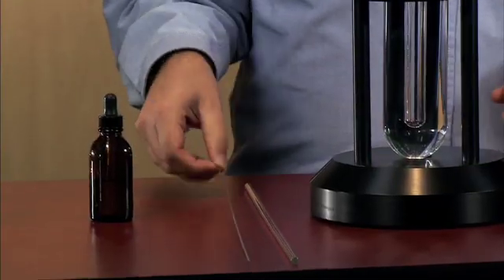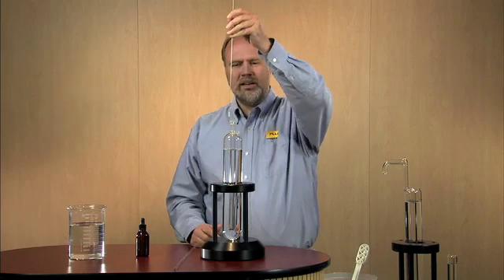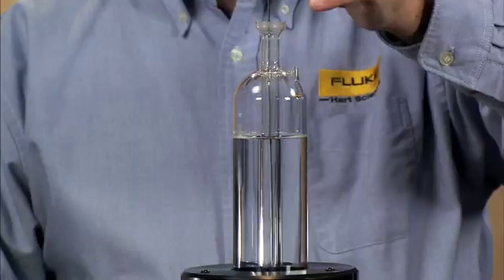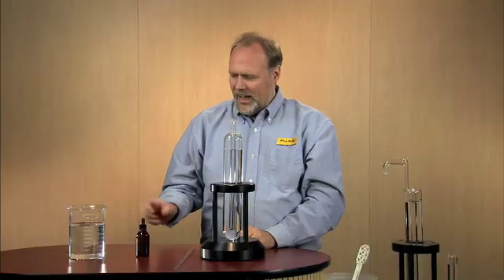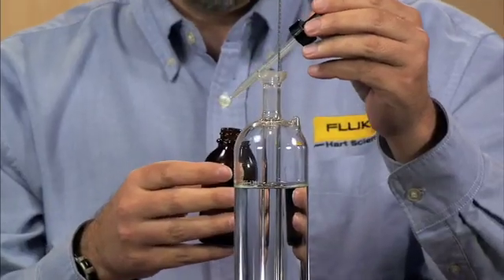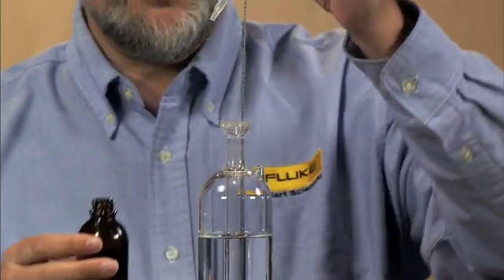I have a wire, a wire long enough to go into the well of the cell and stand there. I have a bottle of alcohol. We're going to put four drops of alcohol into the well of the cell.